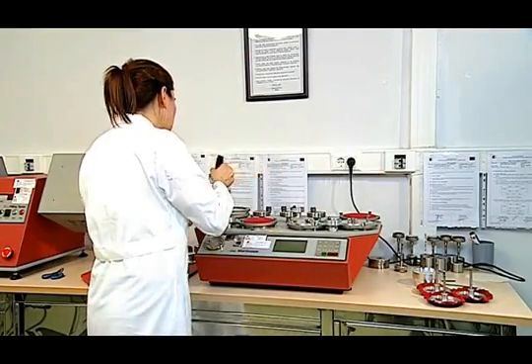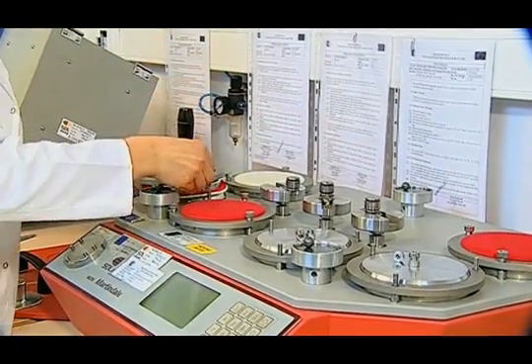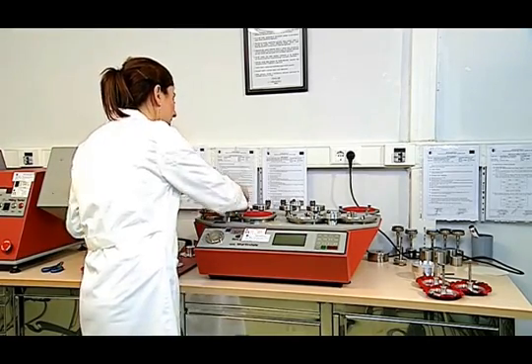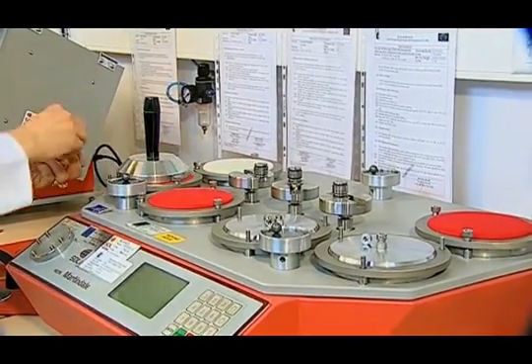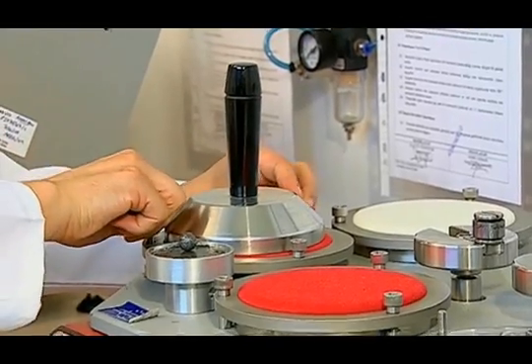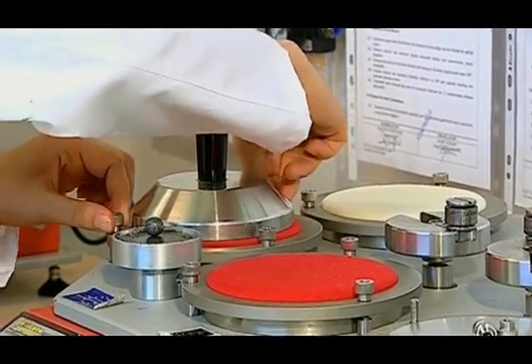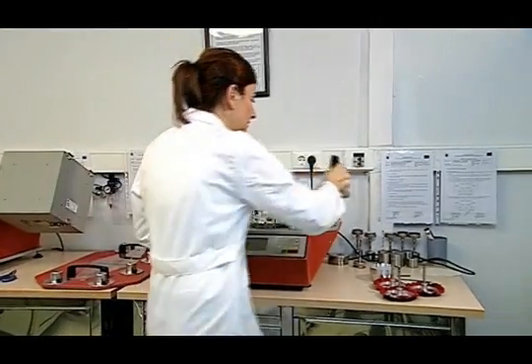As we said before, knitted and woven fabrics are abrasives themselves, whereas 100% woolen abrasive fabric is used for upholstery fabrics. After placing the 2.5 kg presser foot on the sample, the tightening screws are passed through the rings. Screws are tightened on the edges with the screwing apparatus. The presser foot is then removed and the abrasive fabric is placed on the table.